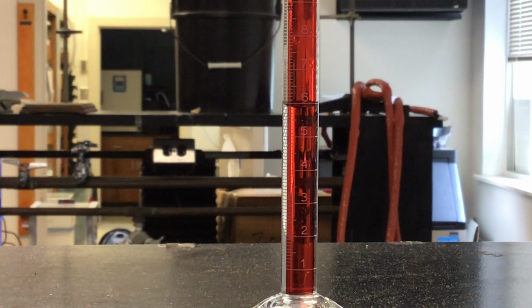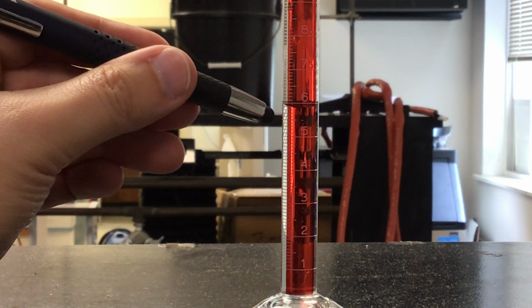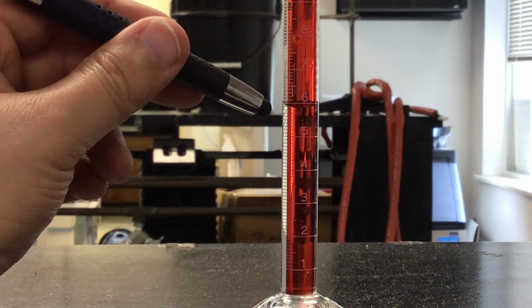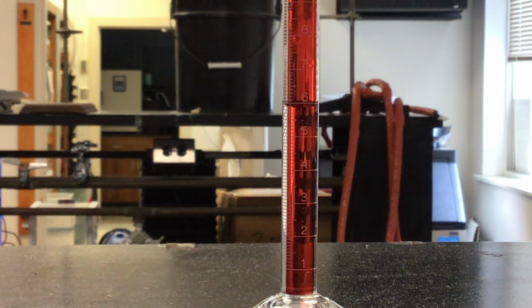0.01 milliliter instead. So again, if I was making a measurement here looking at my meniscus, I want to look at the bottom of that U, that shape that the water has inside the graduated cylinder. From the bottom of that, I think it's a little bit below the marking, just below 6 milliliters. So again, I might report this as, say, 5.88 or 5.89 milliliters. Someone else maybe says it's exactly 5.90 milliliters. But it's important that you would report it as 5.90, not just 5.9 milliliters.